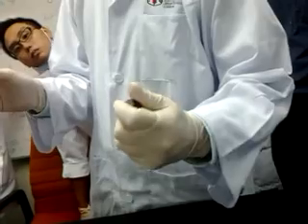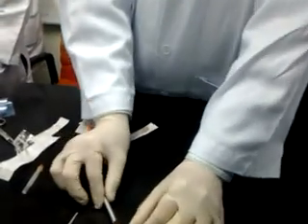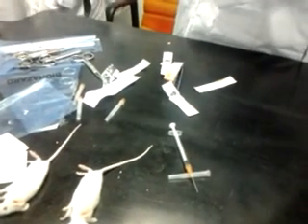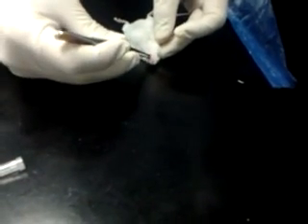You have another way. Maybe I'll give it later. Okay, I'll give one more with the IV. Can you weigh one of them? You can have this one. Okay, this is IM. So we have IM.